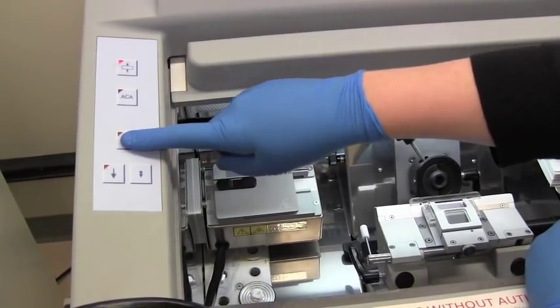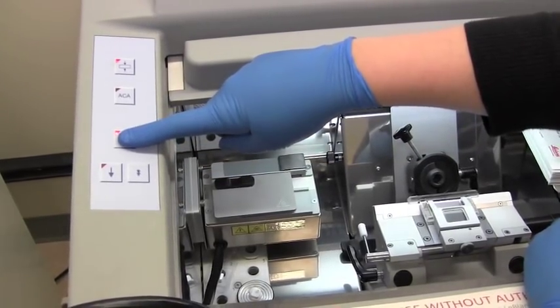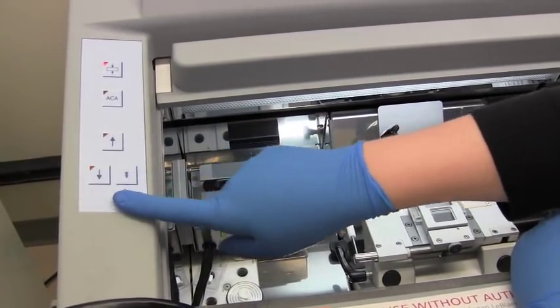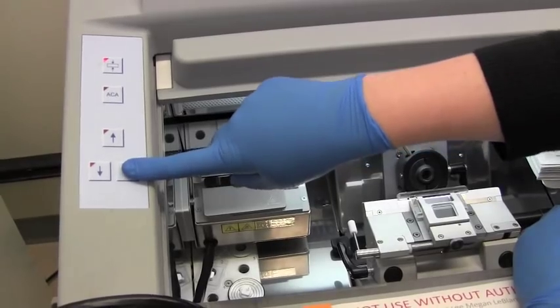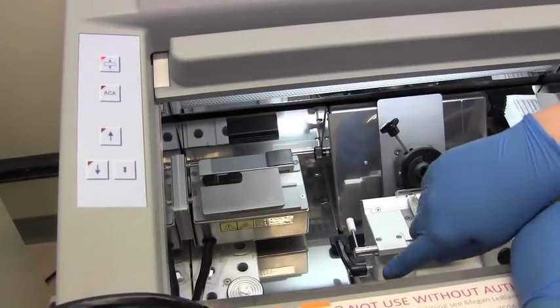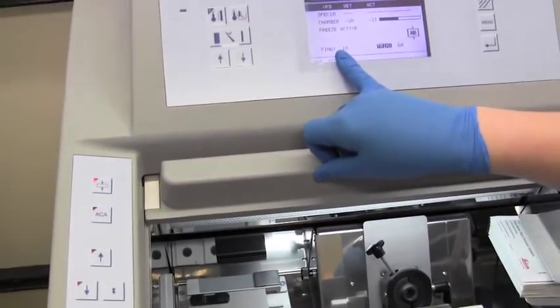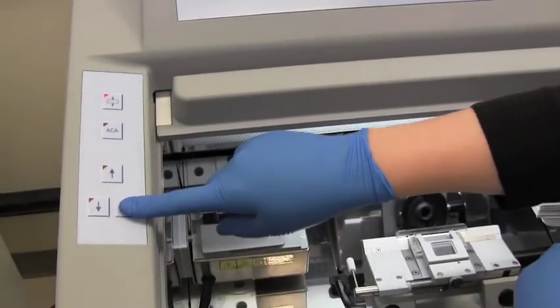You can move it manually backwards. You can move it forward. Or you can move it forward in very small sections. And this is set to your fine advanced setting. So this is at 18 microns every time you push that button.